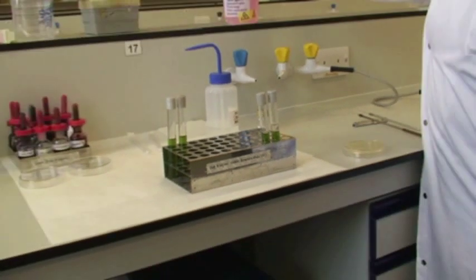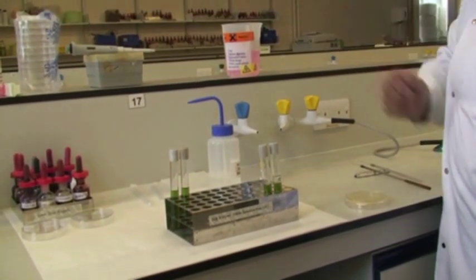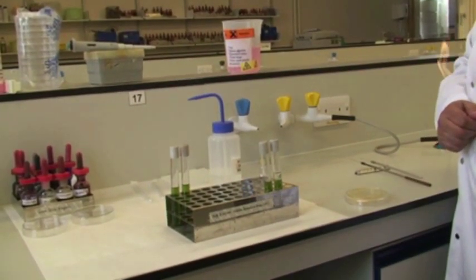And then discarding this into your beaker, and that's ready for incubation.